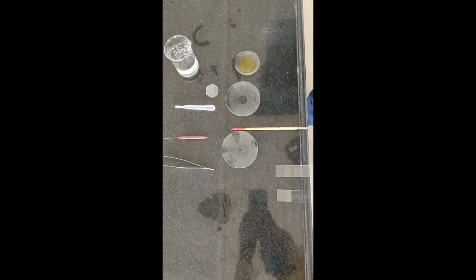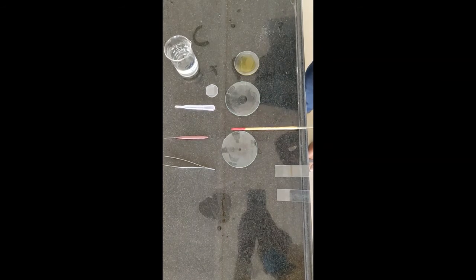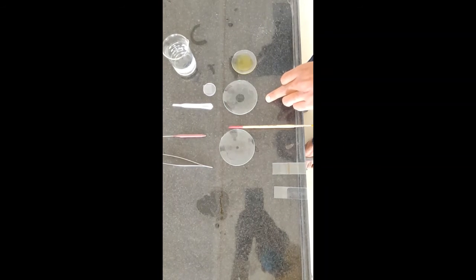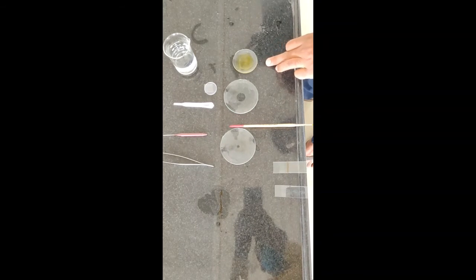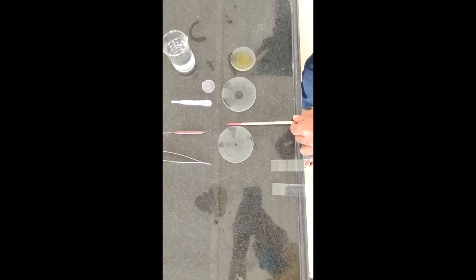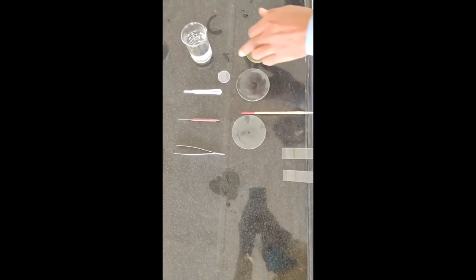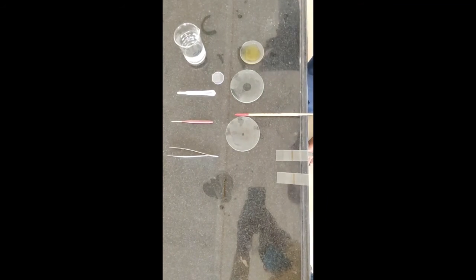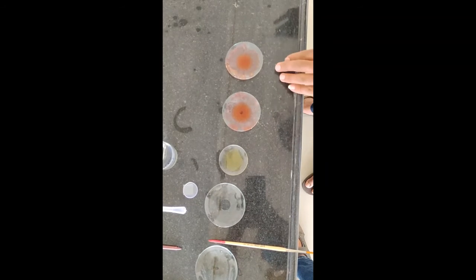For today's practical, we need some chemicals and apparatus. This is phloroglucinol, this is concentrated HCl, and this is iodine solution. These are the watch glasses, this is slide, a camel hair brush, forcep, needle, dropper, cover slip, and glycerin water, ruthenium red solution and sudan red 3.